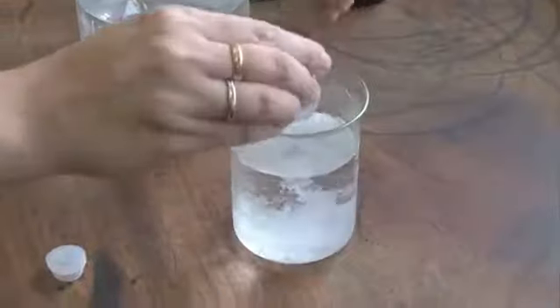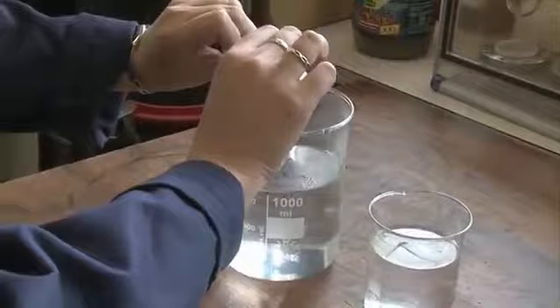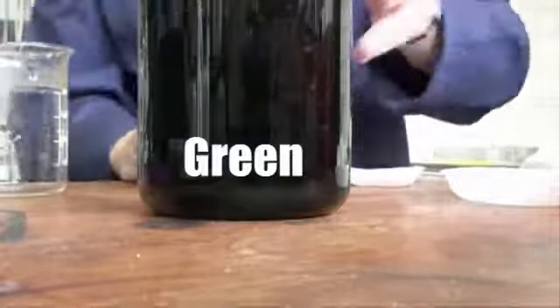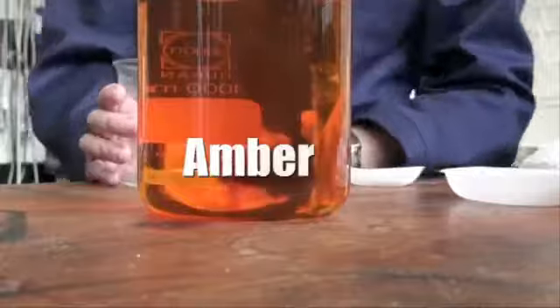Today we're going to be doing a colour change reaction, and it's going to involve solids going into liquids, all getting mixed together, and by the addition of a dye we'll be able to see the reaction changing colour. So this reaction actually has a name, it's called traffic lights. I actually do this at local primary schools when I go out and visit them and show them this reaction, and hopefully you'll be as wowed with this as the kids are.